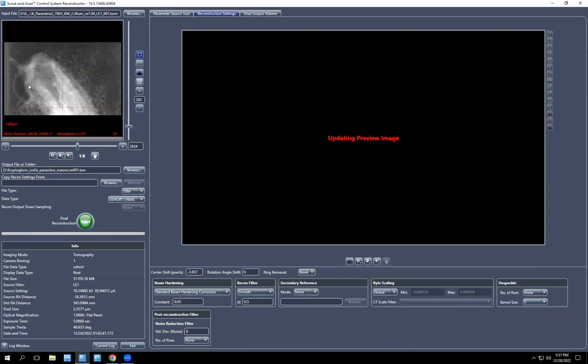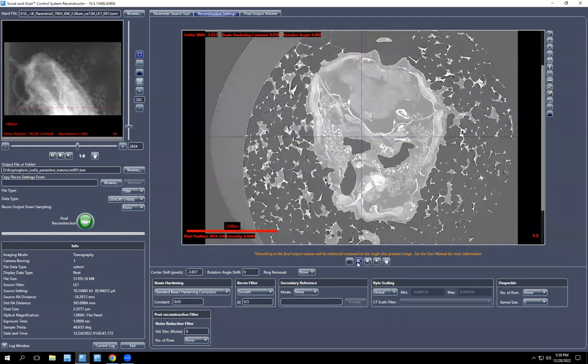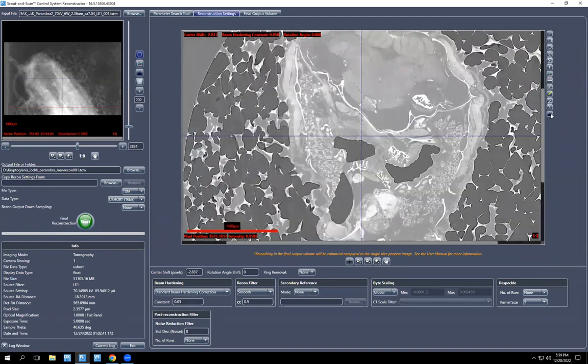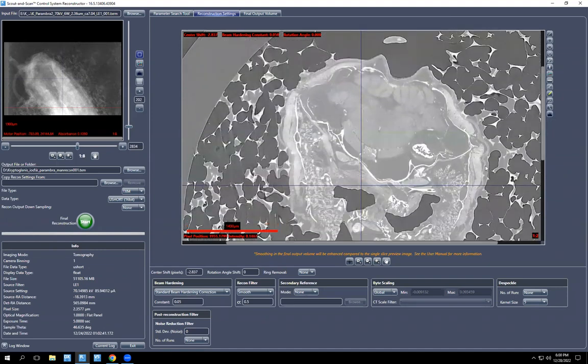Sometimes it just shows you the middle automatically. All right, so this has popped up and we can zoom in, find our otolith, which is here. Once again, we don't know yet what our byte scaling is going to be. Well, we secretly do know. So the way to find out what it needs to be is to use the line graph tool. Click that, drag a line through the densest and some less dense structures.